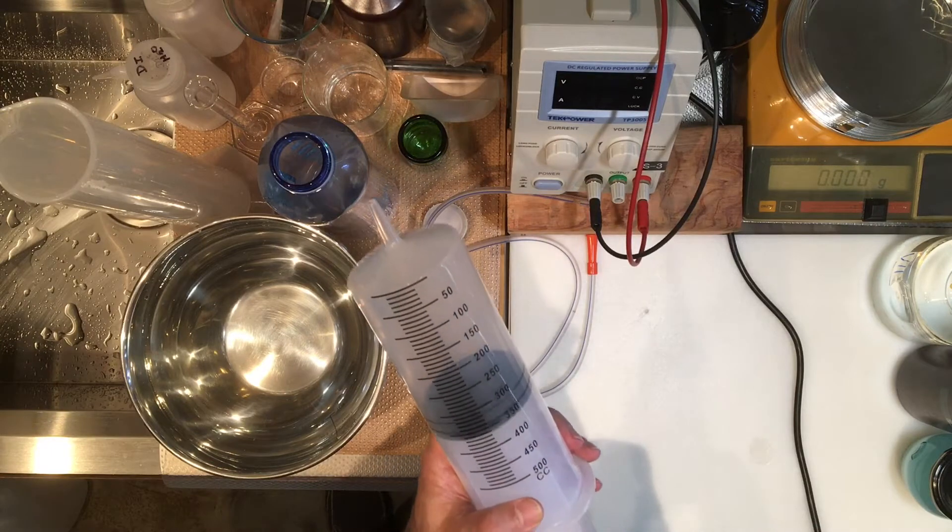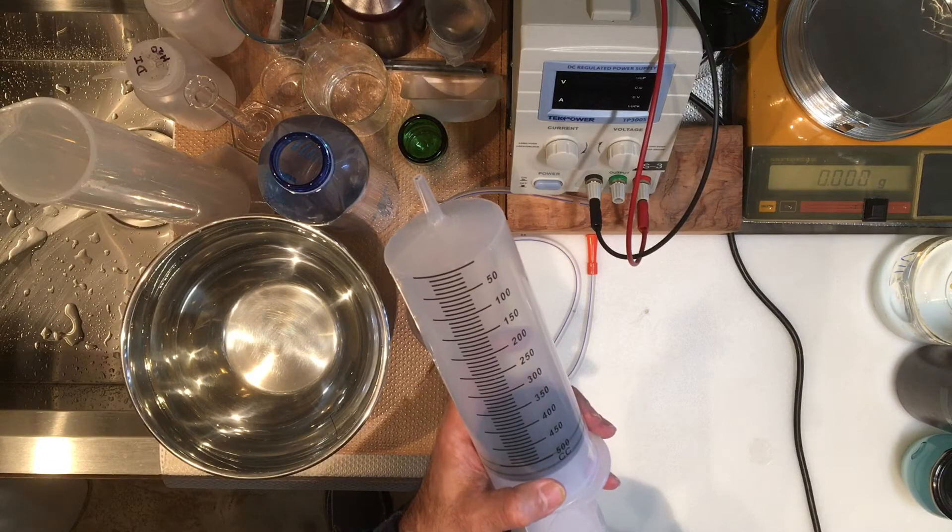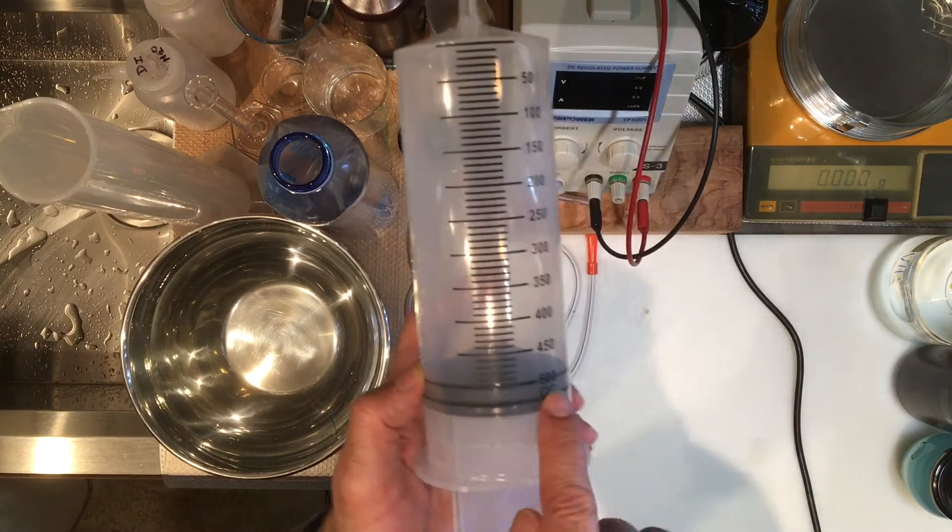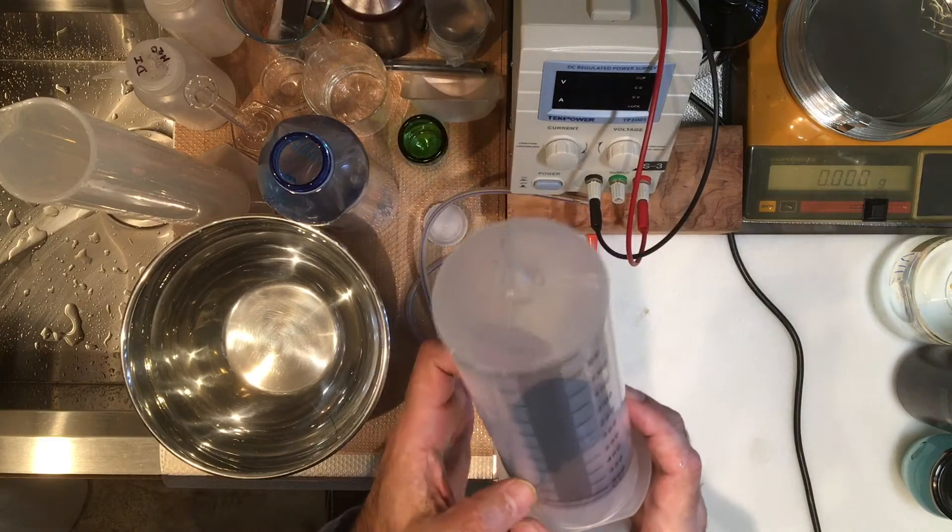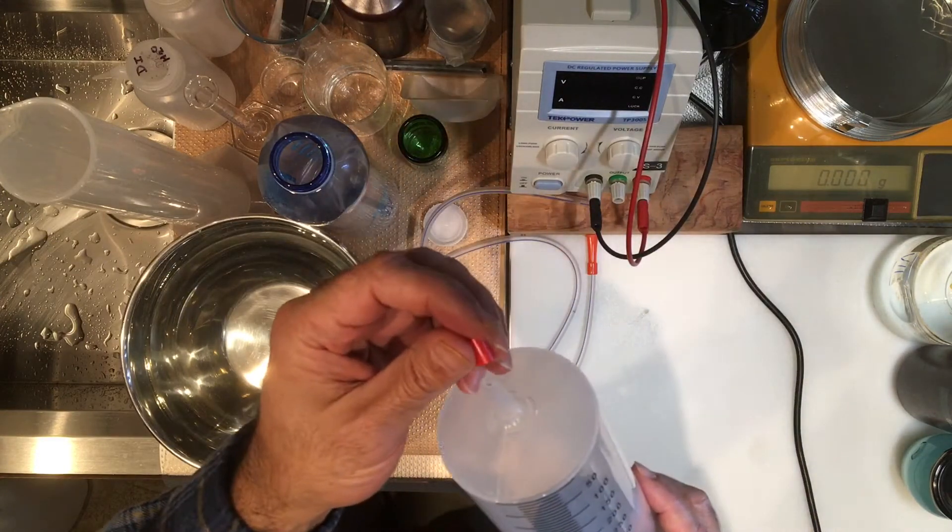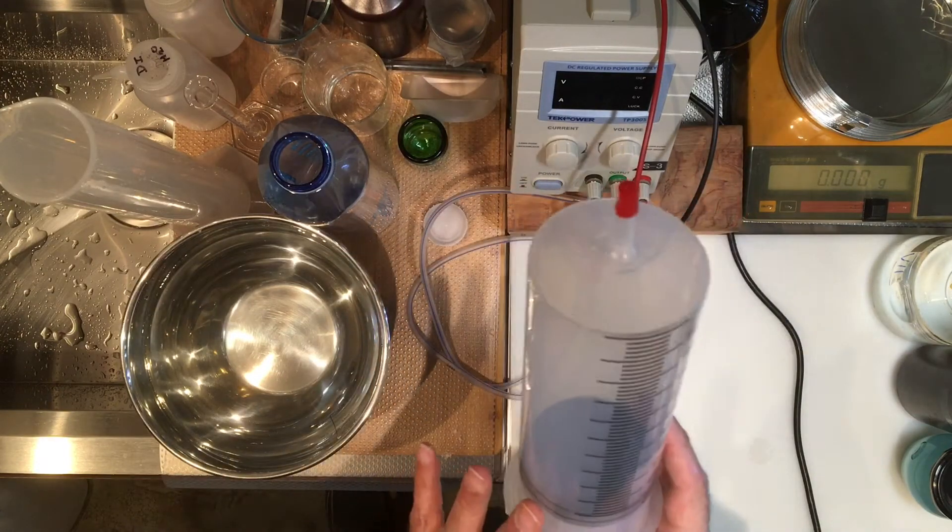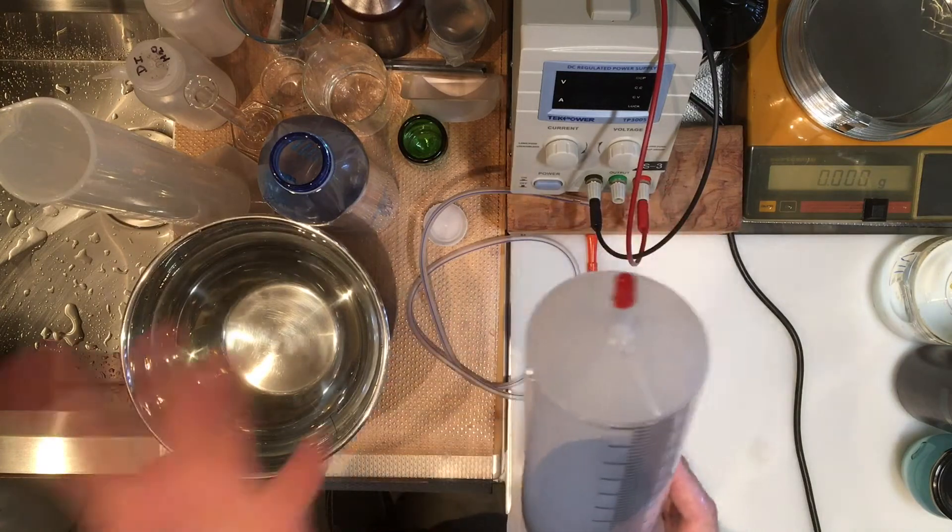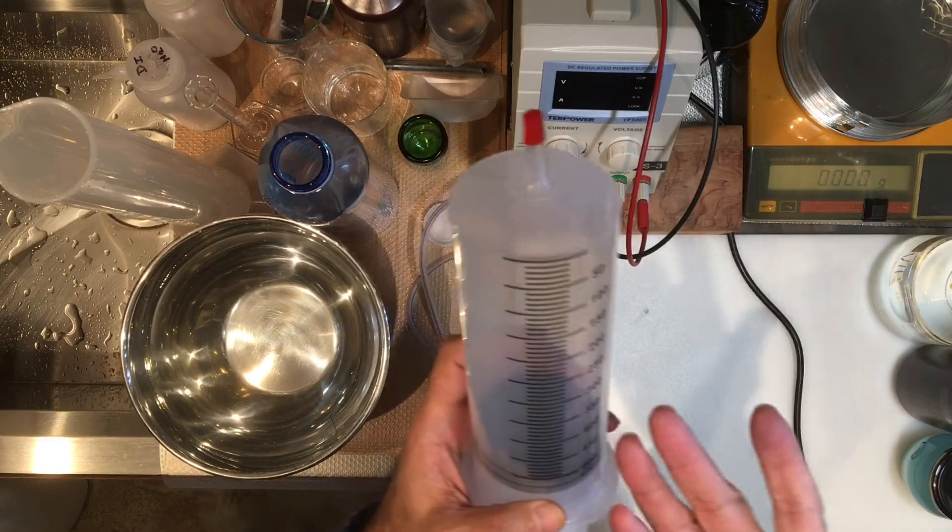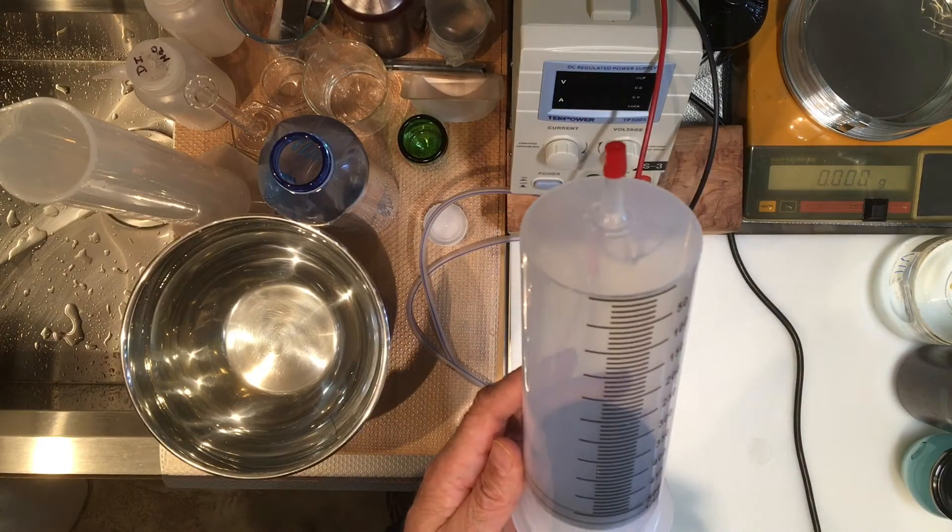I'm going to fill this syringe with water and bring it to the 500 milliliter mark so I'll know exactly where the line is. I'm going to fill it up to the point that is completely full, put the cap on, and weigh the syringe empty and then fill with water. If you subtract the masses you'll get the mass of water, and knowing the density of water we can calculate the volume of the syringe.